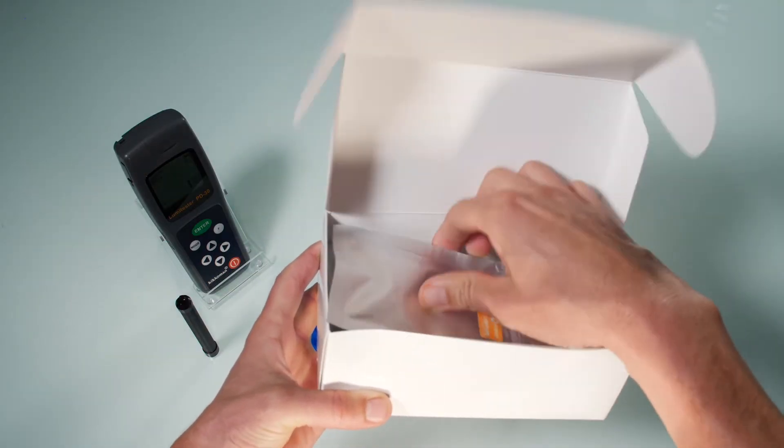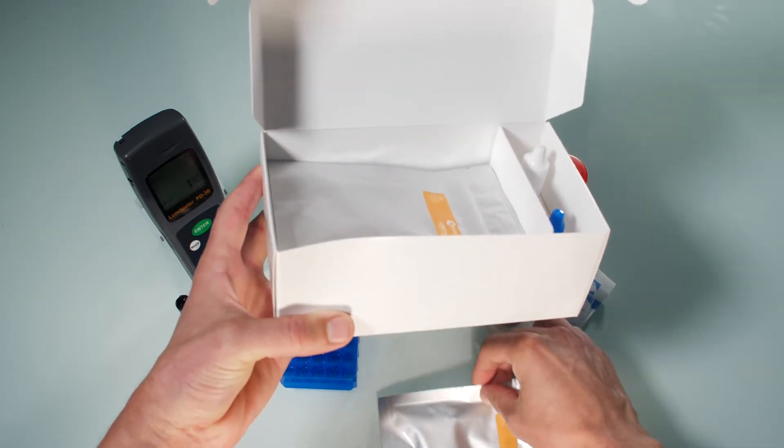Open the box and take out a lumi tube pouch and the two reagent tubes labeled extractant and standard.